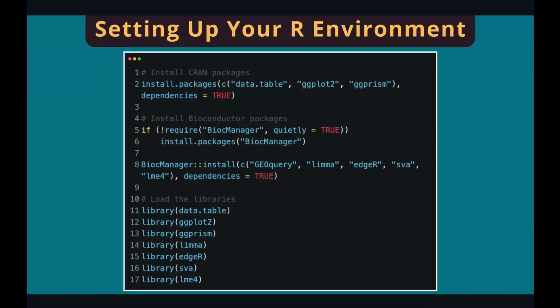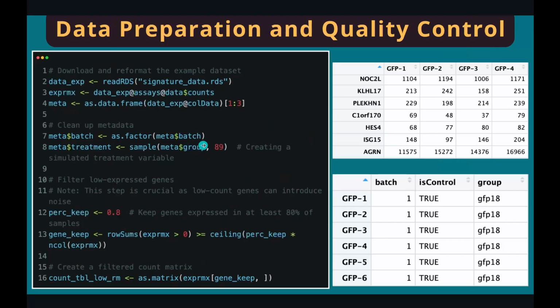The batch effects adjustment can be done in R environment. The first step is to set up your R environment. Open R and RStudio, install all the required packages, and load them. The example dataset can be downloaded from the ComBat-seq GitHub and can also be downloaded from my website, ngs101.com. The dataset is in the format of an R object. You can read an R object using the readRDS function.